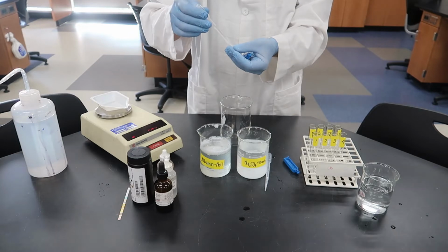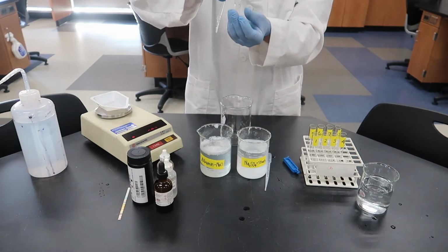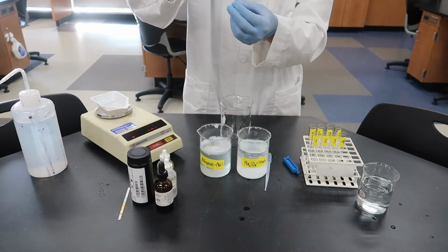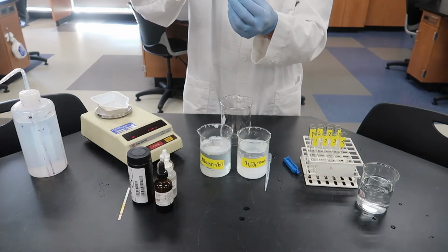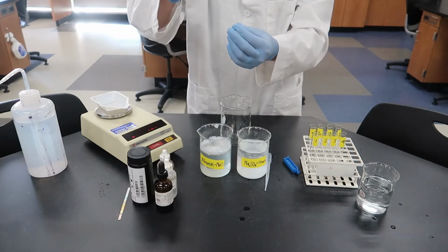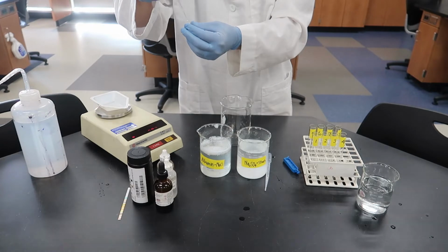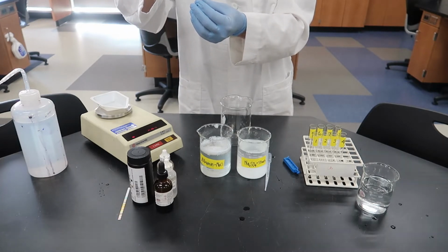Okay, we'll squirt a little bit of that in there, and that kind of helps open it up a little bit. Dialysis tubing is not exactly the same as a cell membrane, but it makes a good comparison in this lab. Cell membranes are also semi-permeable. Certain things will pass through a cell membrane, certain things will not. Dialysis tubing is not alive, it's not from a cell, but it is also semi-permeable.